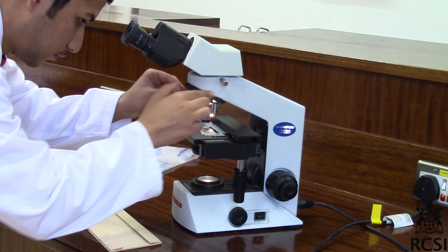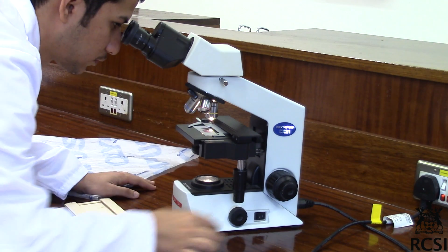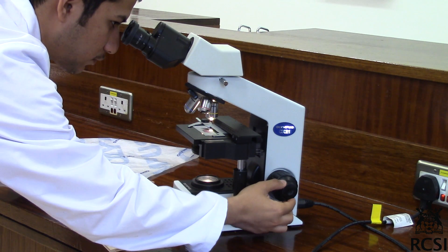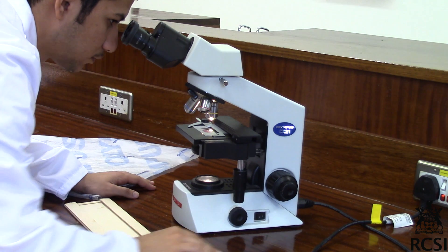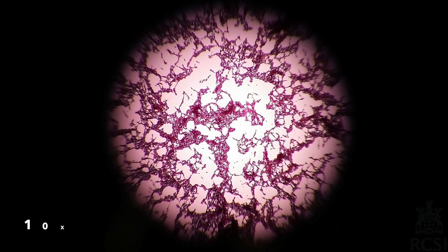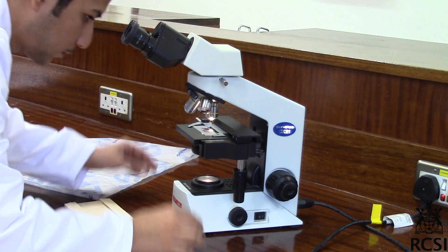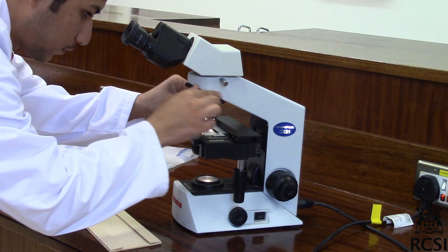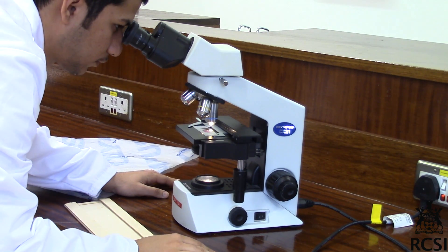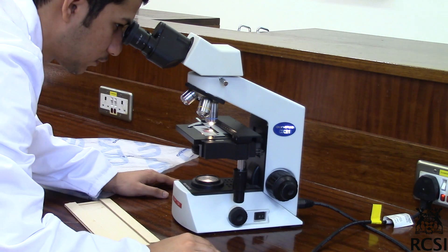Rotate the nosepiece to the 10x power lens to see more details, and use the fine adjustment knob only. You can also rotate the nosepiece to the 40x power lens to see more details, again using the fine adjustment knob only.